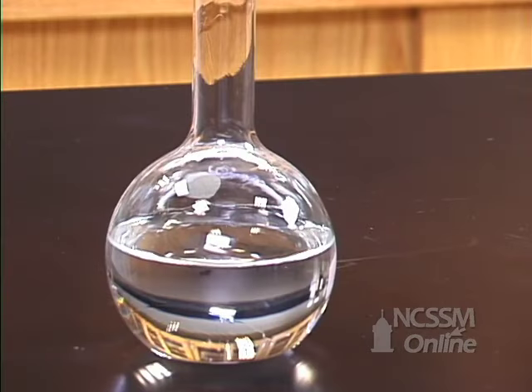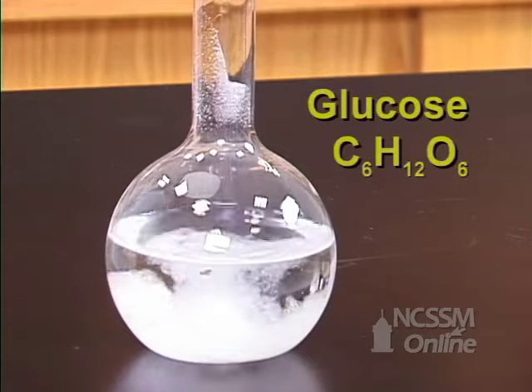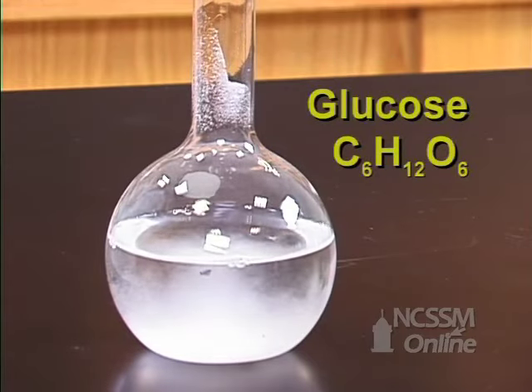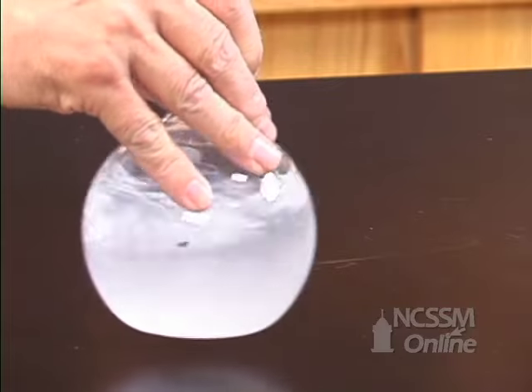In the flask I have some distilled water. I'm going to add some glucose to the water. I'm going to swirl this and have the glucose dissolve.